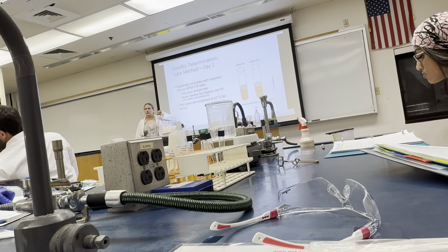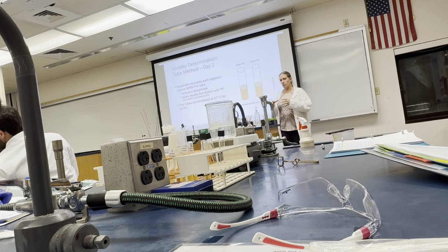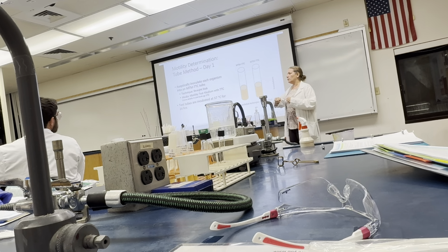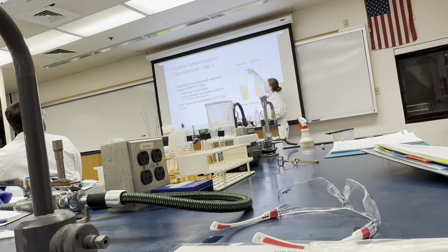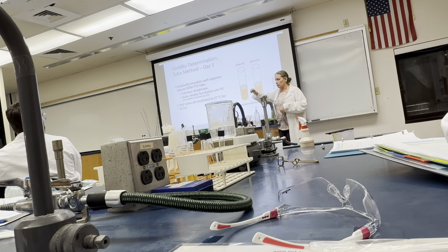So that means you're going to use your inoculating needle in this case. I know that the cultures are coming from a broth, but that's okay. You're going to use the inoculating needle and straight stab, which means you stab straight down, almost to the bottom, and pull up, hopefully on the same pathway. So people who have a little more of a handshake, don't stress. Do the best you can, but you want to go straight down and pull straight back up. That's it. It's inoculated.